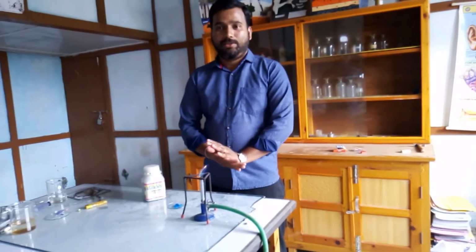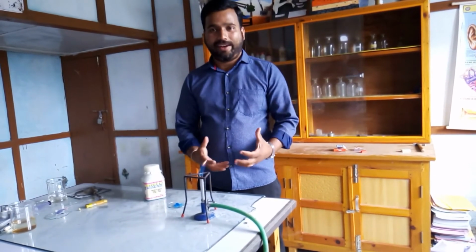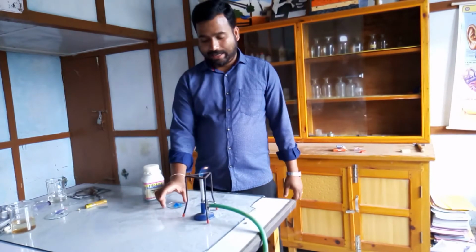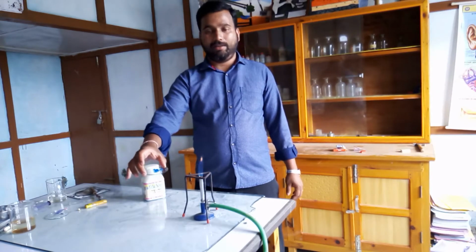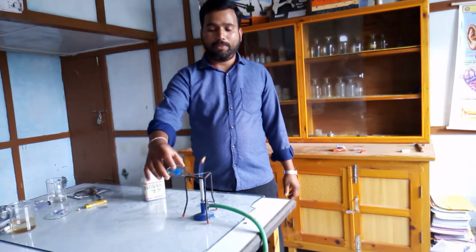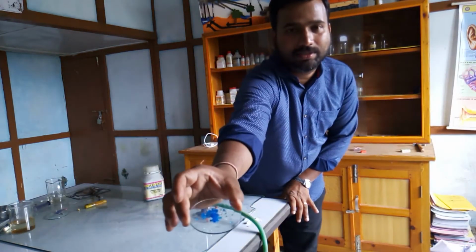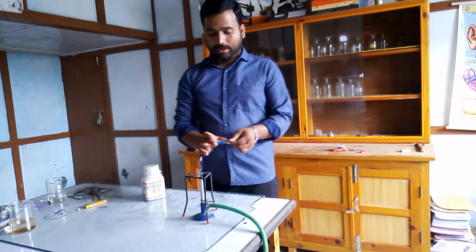Hello dear students. Now we are going to see the next type of chemical reaction, known as decomposition reaction. In this video we are going to try a chemical reaction in which a compound called copper sulfate decomposes. Observe the color of copper sulfate. It is blue. I will show you somewhat closer. Observe the color of blue copper sulfate.